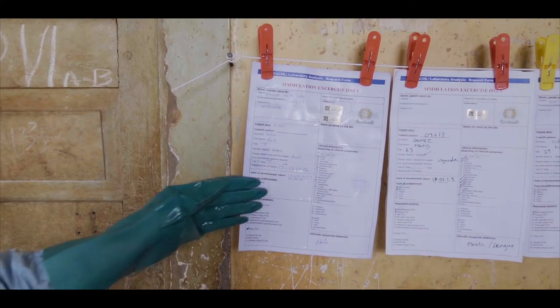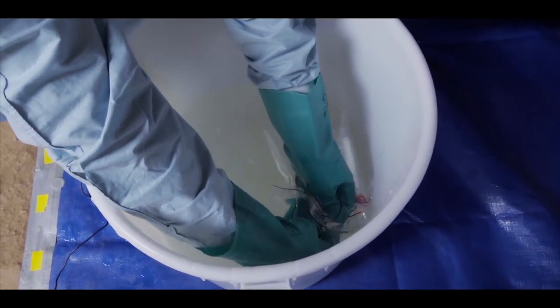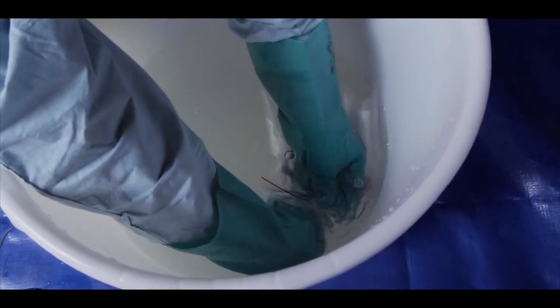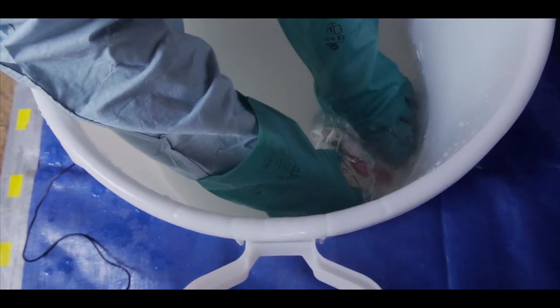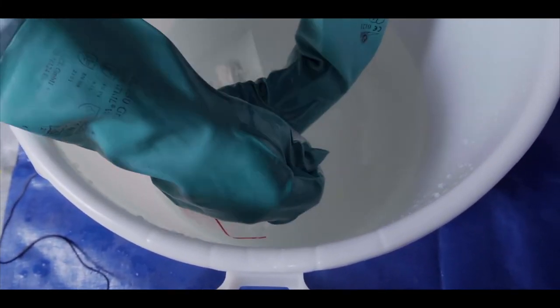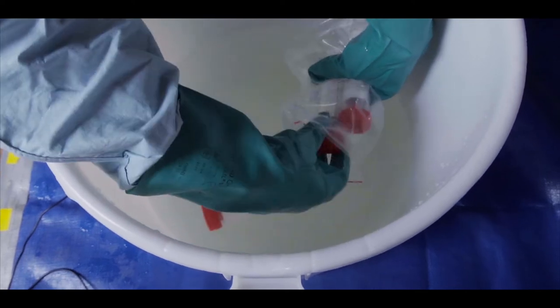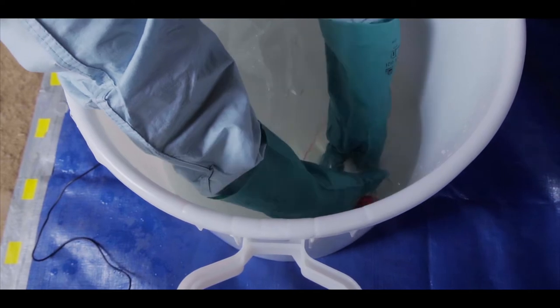Under the bleach, we open the zip. Sometimes the sample comes in a bigger bottle or container, but we open it under the bleach. When you open the zip, you make sure it takes in the bleach, then you gently pour away the bleach. Once you have gently poured the bleach away, you can expose the samples, making sure they are tight and properly immersed.